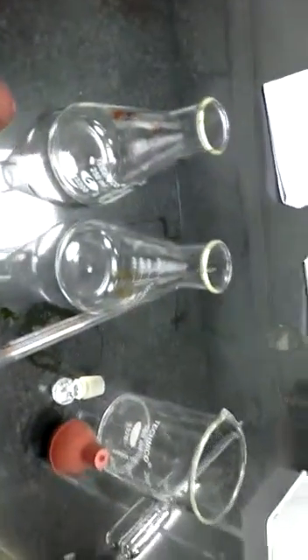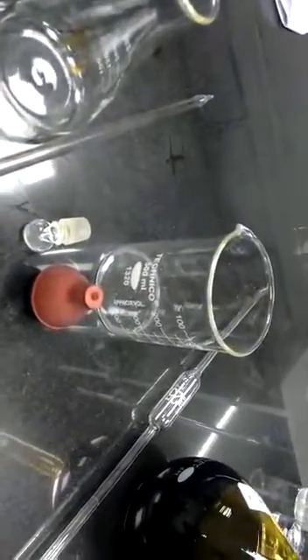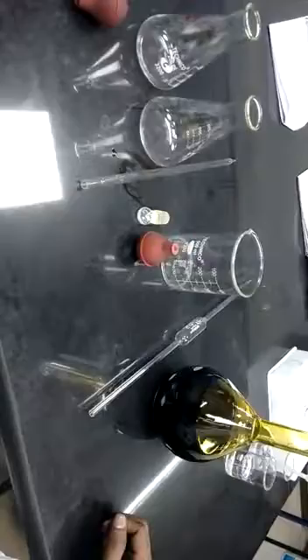25 ml of iodine has to be taken and poured inside the conical flask. After that, do the titration against sodium thiosulfate solution. So this is the procedure — it will start now.